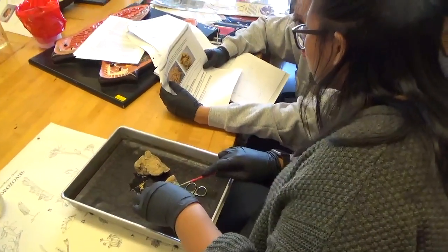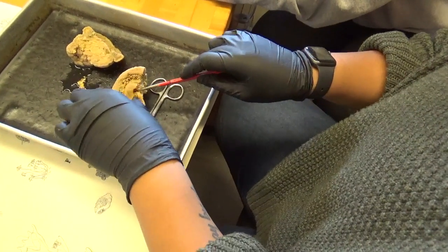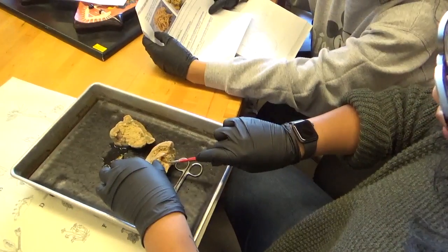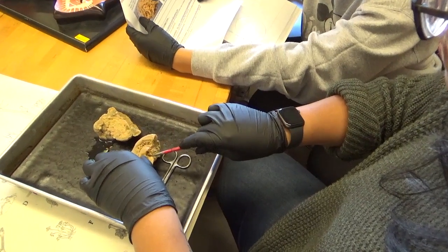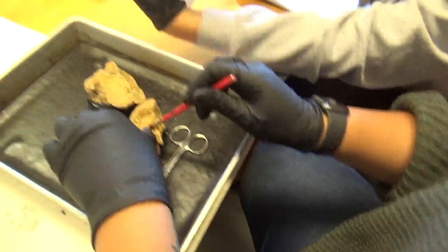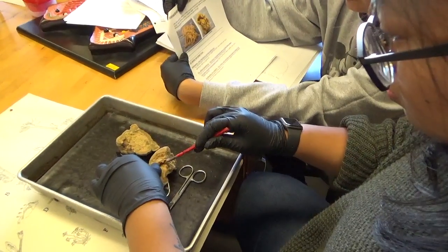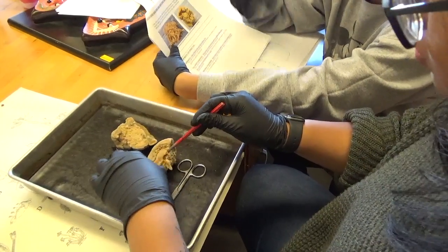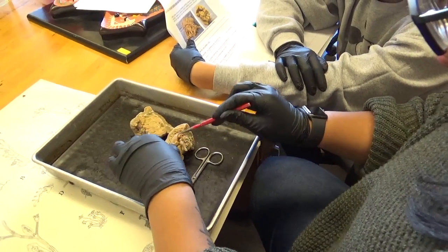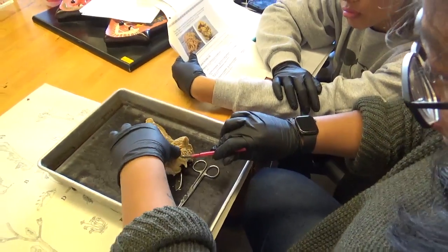So how's it looking in there? So here are the tentacles. Yep. And then this is the mouth. Yep. So I'm sure this would lead to the stomach or the gastro. What'd you say? I can't pronounce this word. Oh, siphonoglyph. Right. Basically, that's the part that sucks in water to inflate the animal. But you're right. The entire stomach is the gastrovascular cavity. So this is this cavity right here. Yes. Is that correct? Okay. Yes. Okay. What's your question?